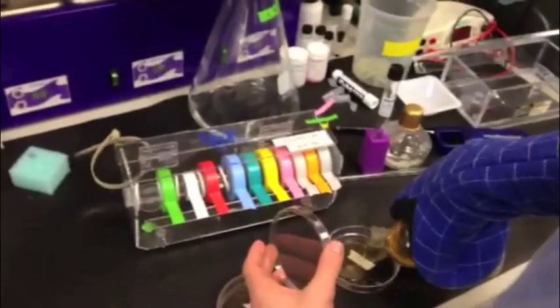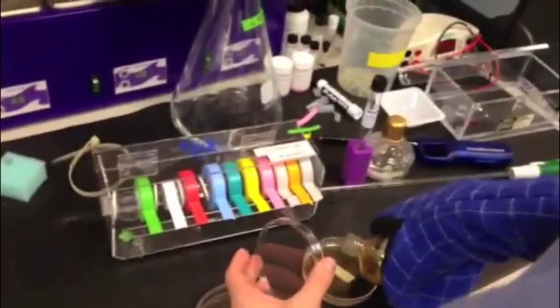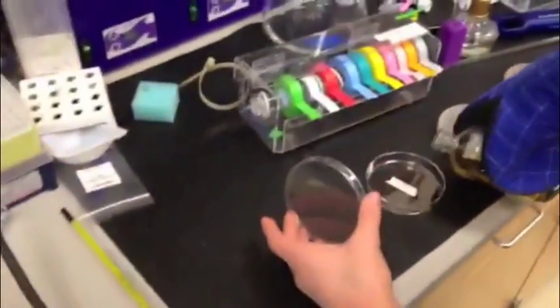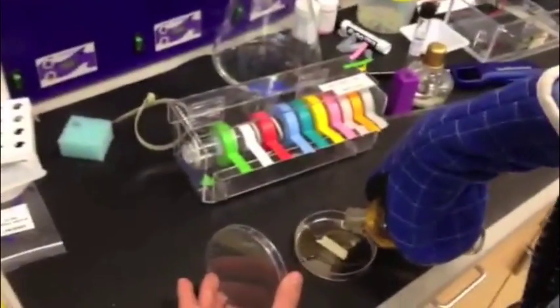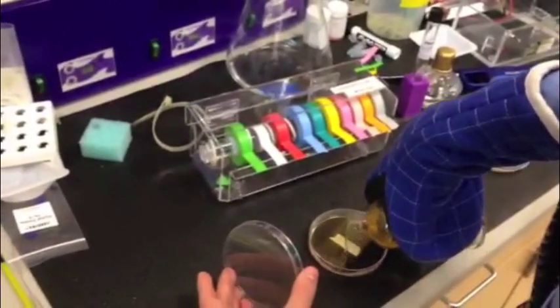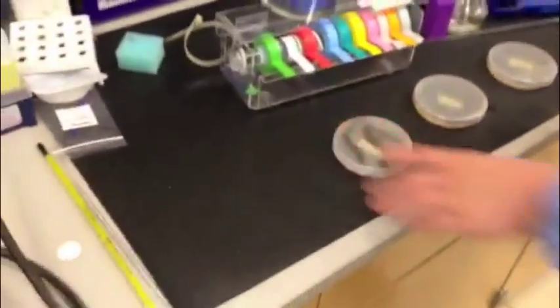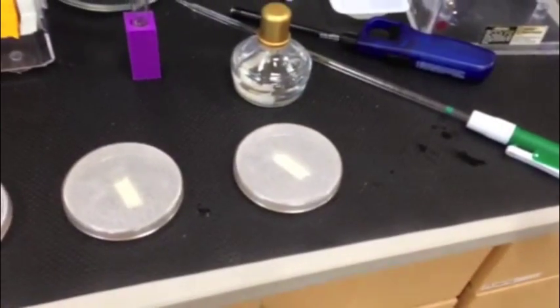We then pour the agar into two more petri dishes that will be used as our experimental petri dishes throughout the duration of this project. Here are the three petri dishes after the agar has been poured into each one.